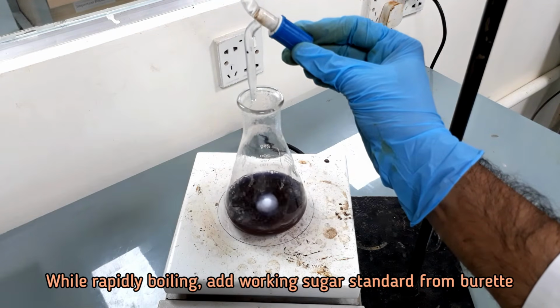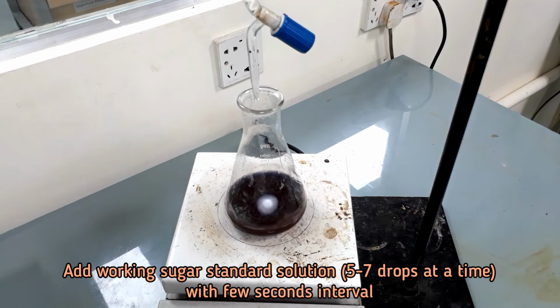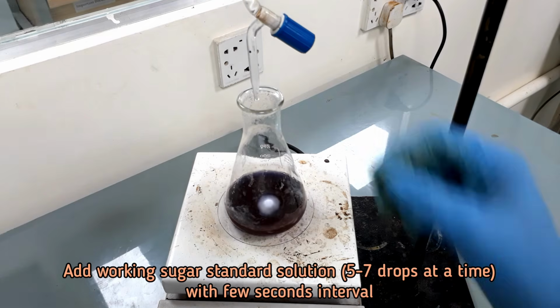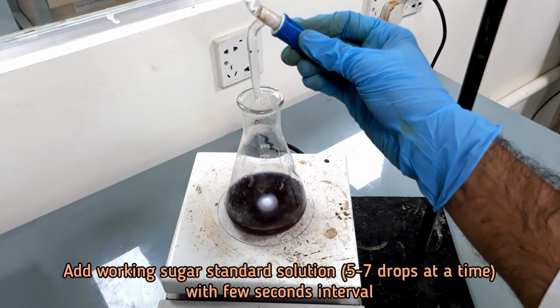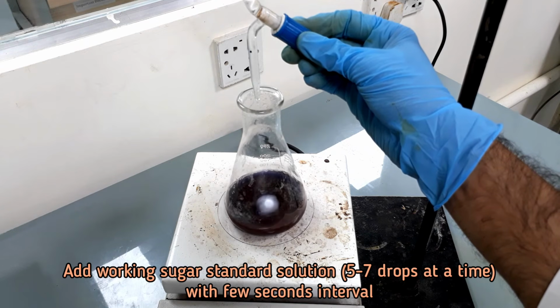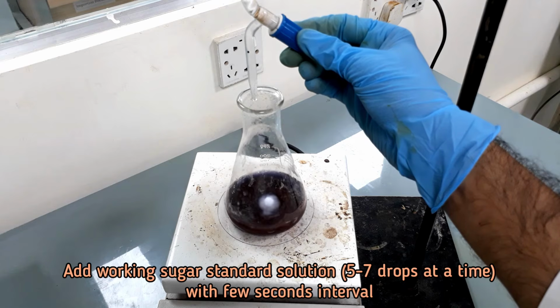While rapidly boiling, start titration by adding working standard from the burette. Titration should be carried out in a manner that adds 7 drops at a time with a few seconds interval, and again add 7 drops at a time.